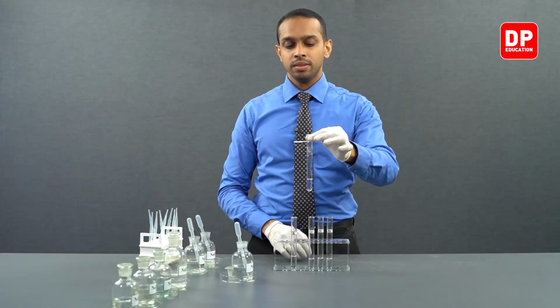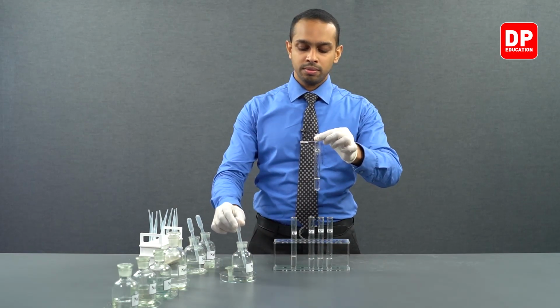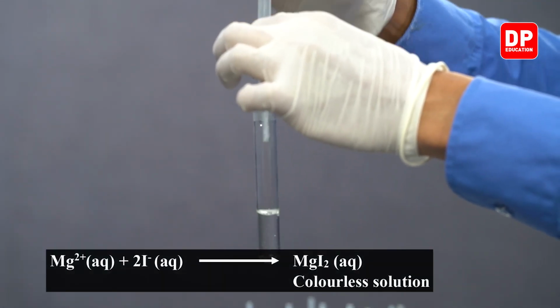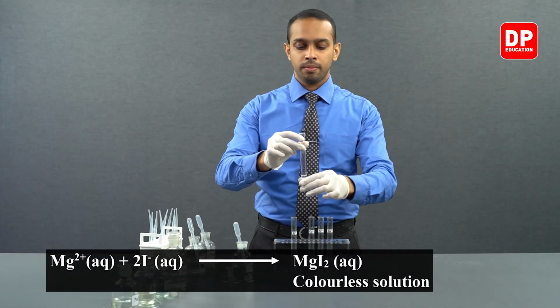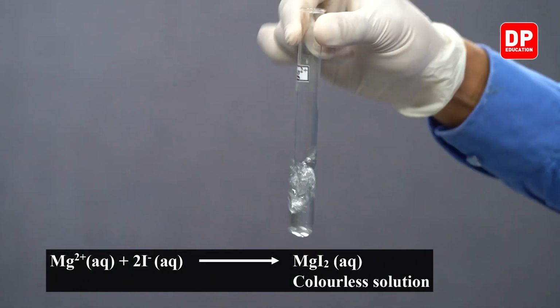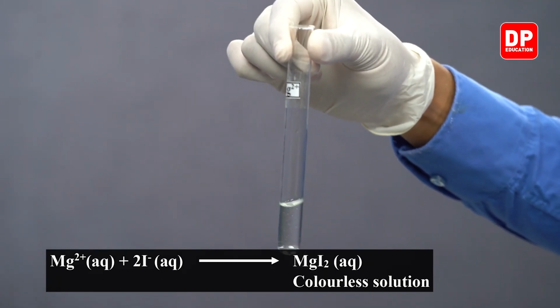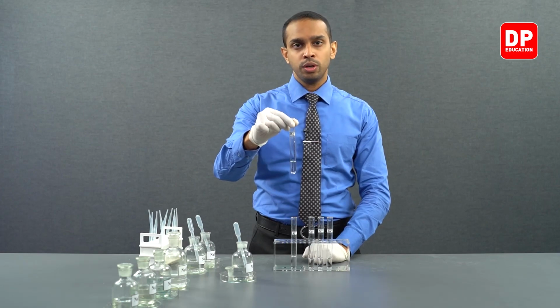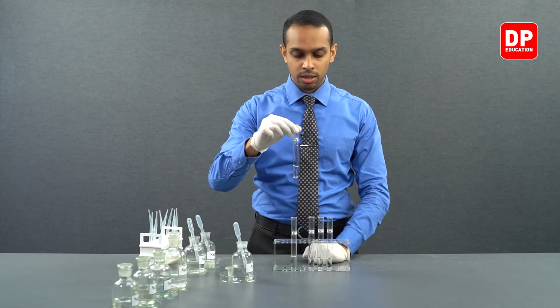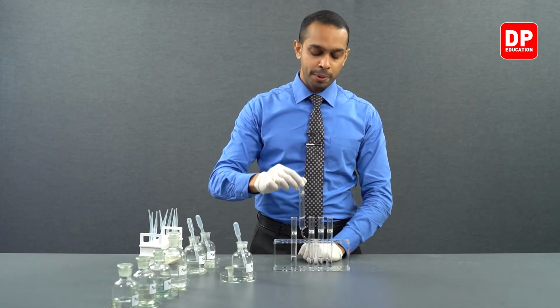We have here our magnesium 2 plus ion solution. To that, I am adding a small amount of sodium iodide. And as you can see, when magnesium ions are reacted with iodide ions, we form magnesium iodide, which is also not forming a precipitate. Since magnesium iodide is soluble in water, you can see we do not observe a precipitate.